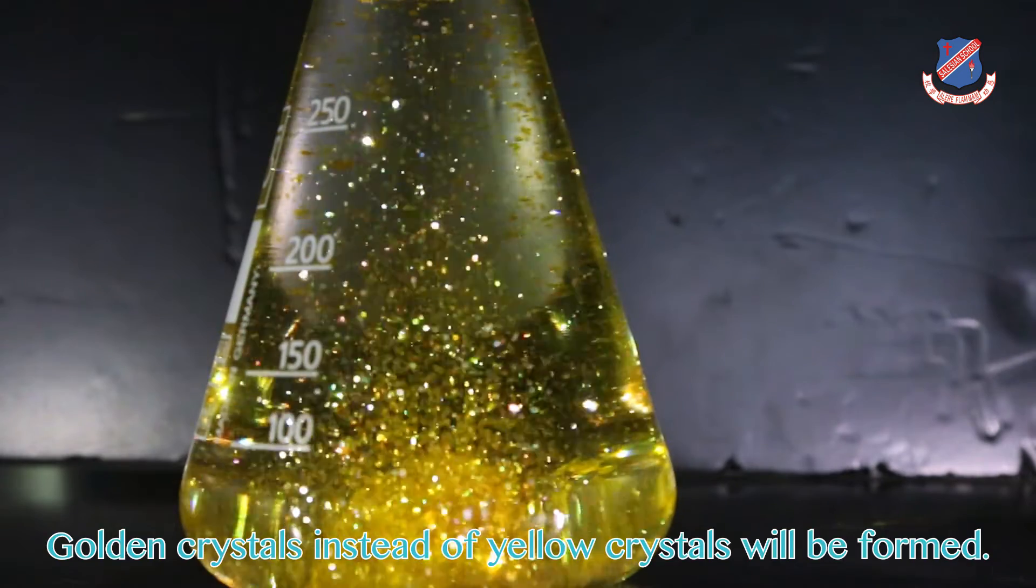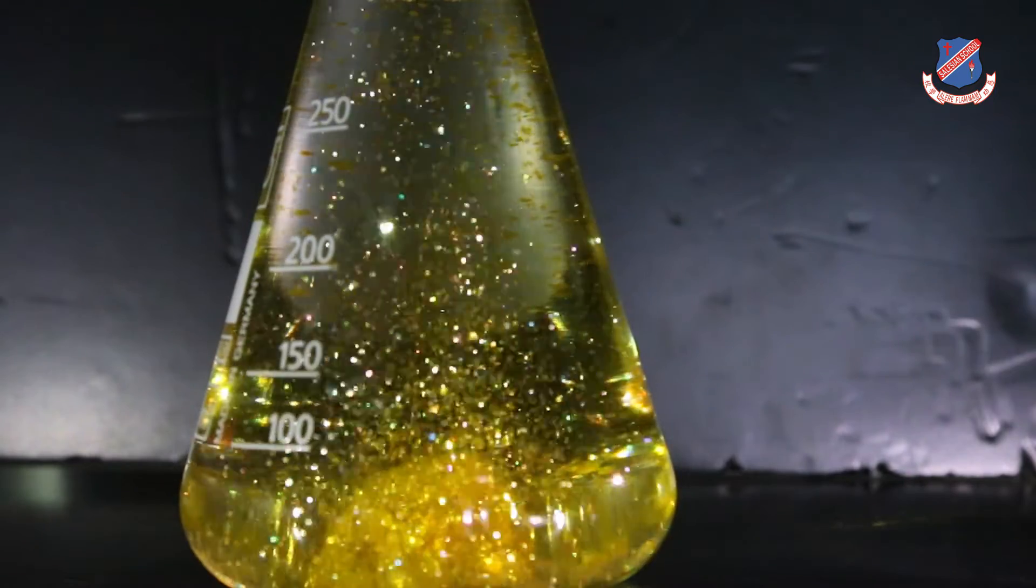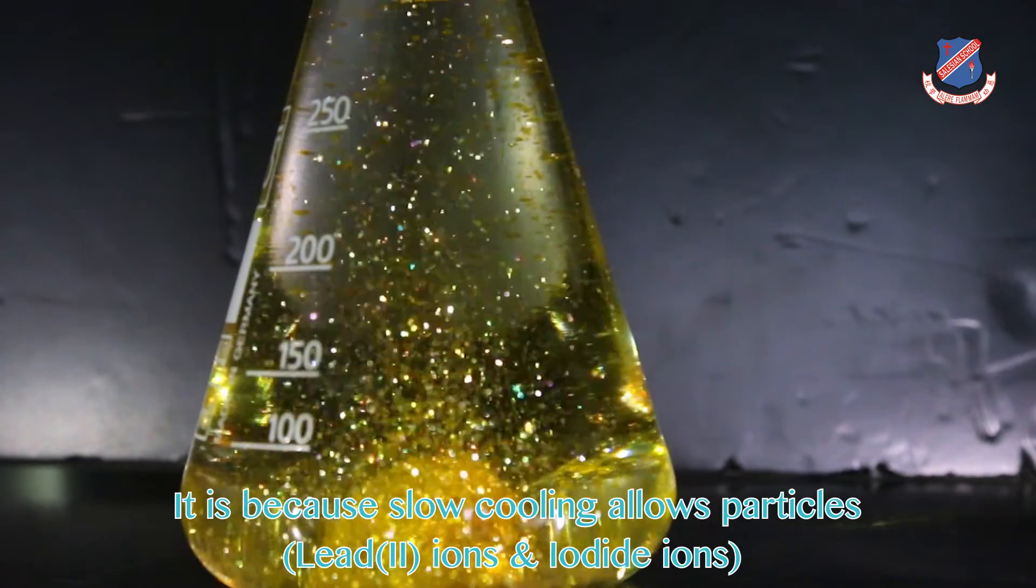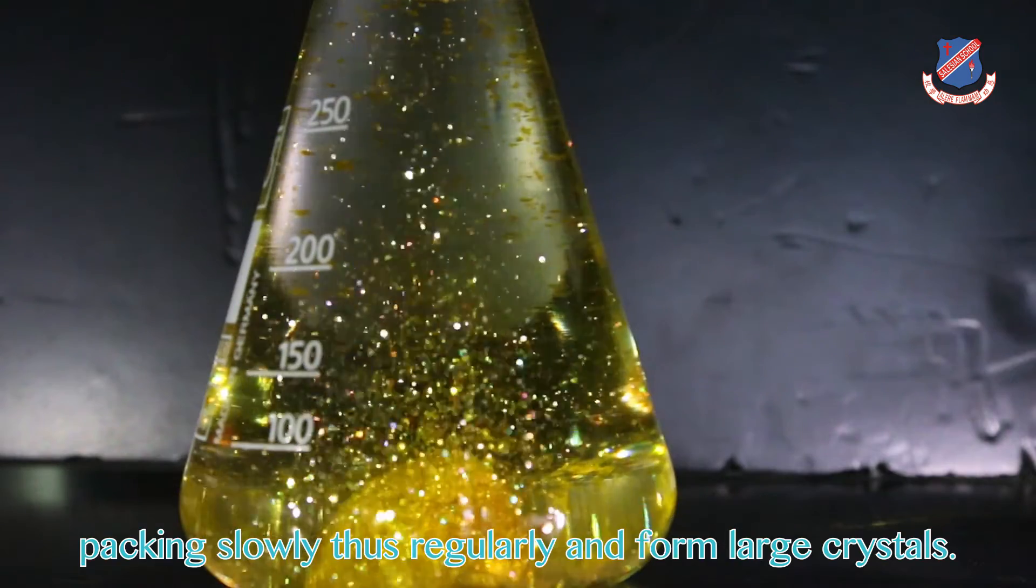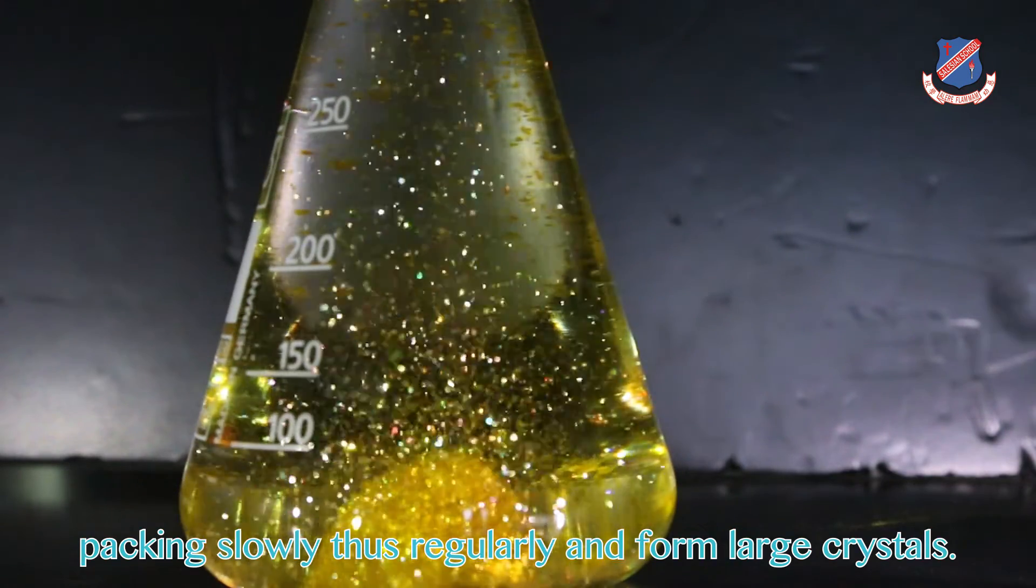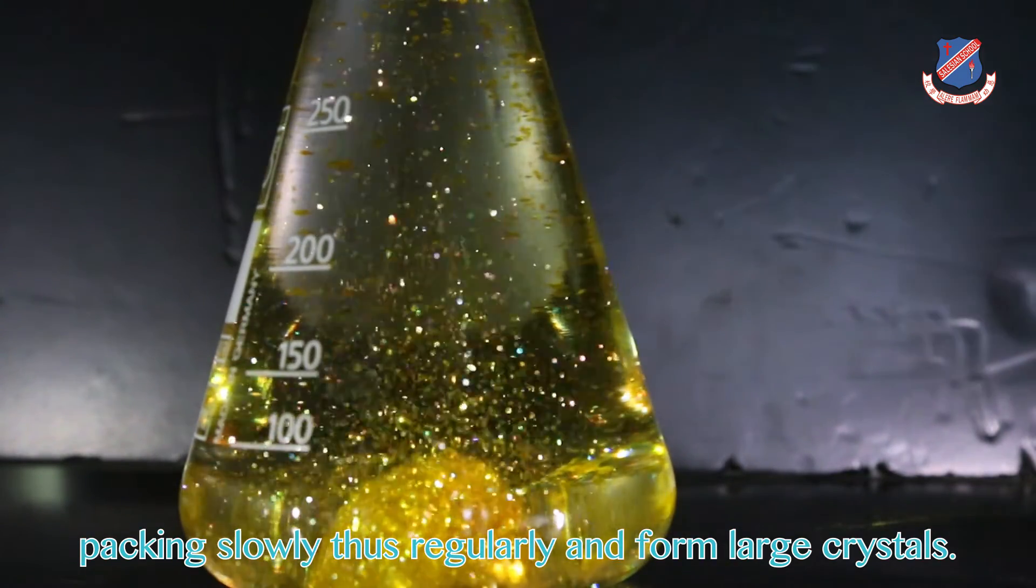Two hours later, golden crystals instead of yellow crystals will be formed. It is because slow cooling allows particles packing slowly, thus regularly, and form large crystals.